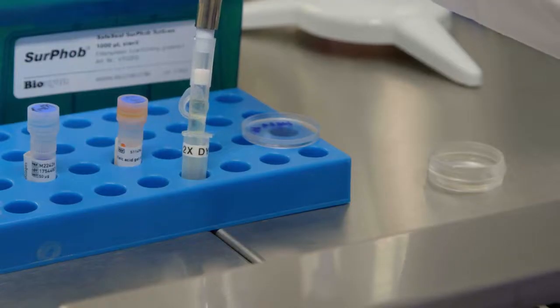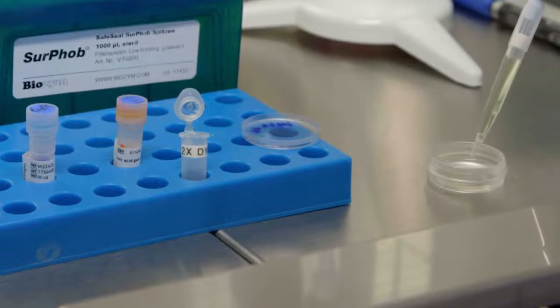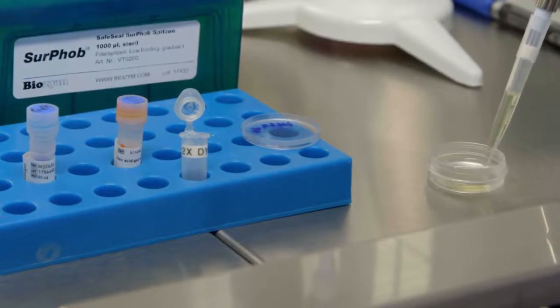To achieve preferential nucleoid staining, one should use SYBR Gold and nothing else under the conditions that we have optimized. Otherwise, total cellular DNA may be stained.